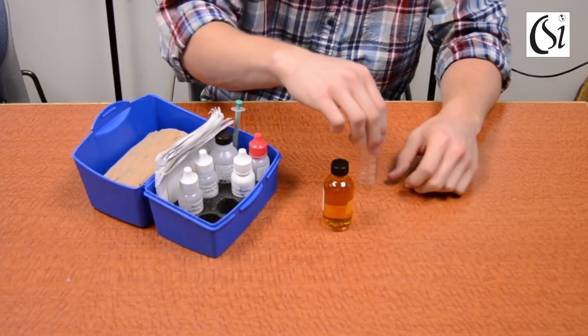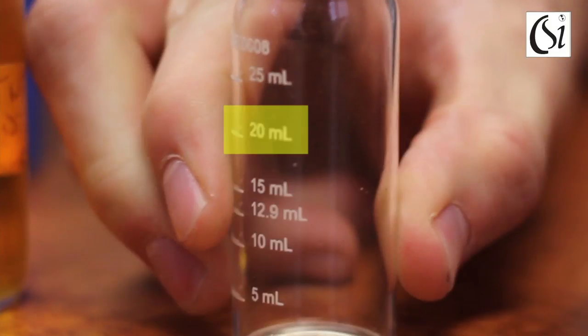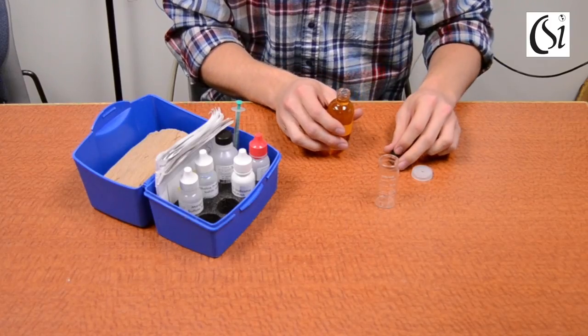Once the precipitate has dissolved completely, fill the test tube to the 20ml line with your sample water and cap.